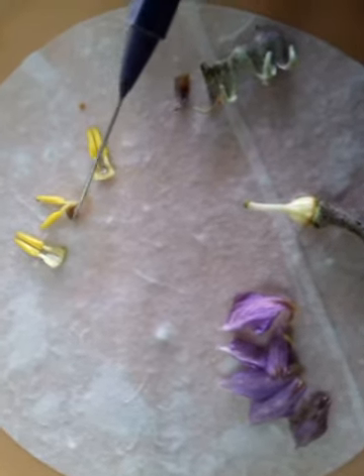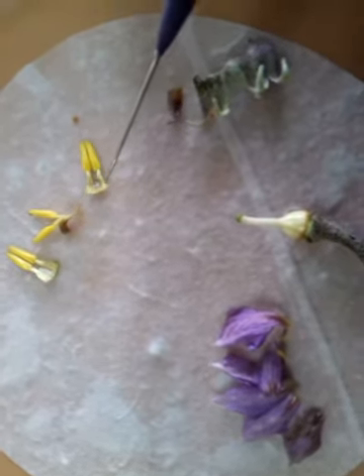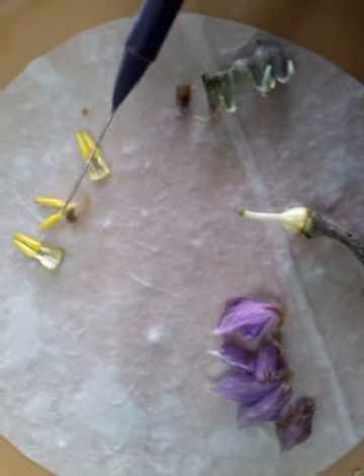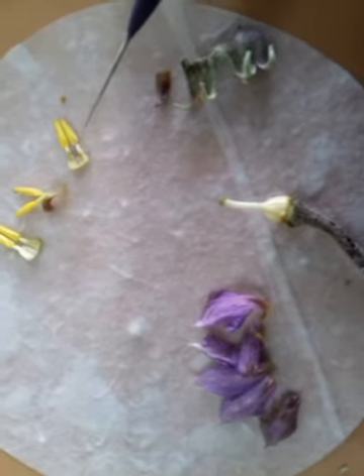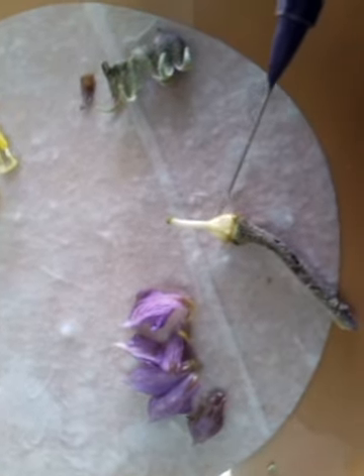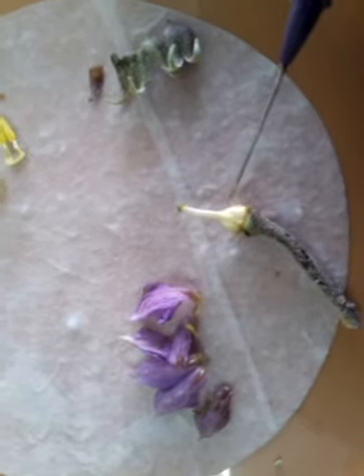So all are together. The sepals are gamosepalous, and the petals are gamopetalous, united. And you can see these androecium, they are polyandrous and attached at the base of the petals. There are usually 5 in petunia, here it is 6. And this is the pedicel of the flower, and this is the gynoecium, the style and the stigma of the brinjal plant. And of course, here you find the ovary with axile placentation.